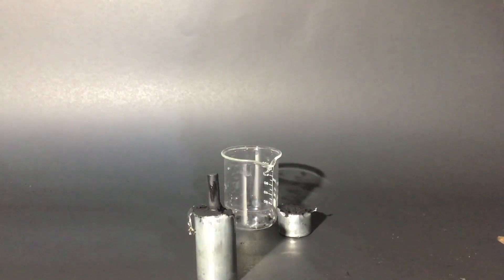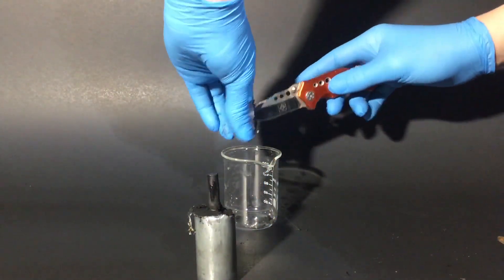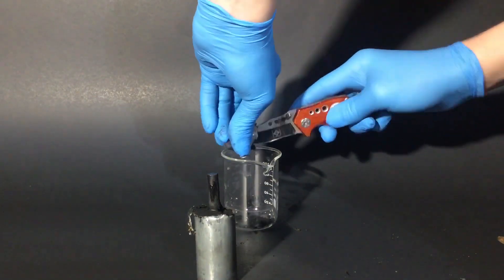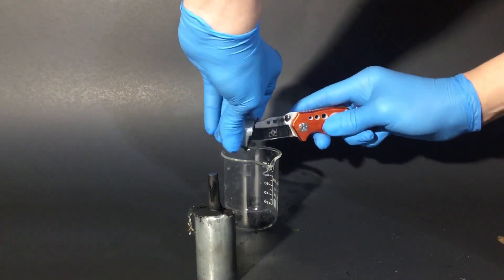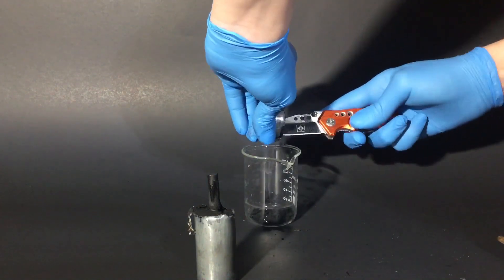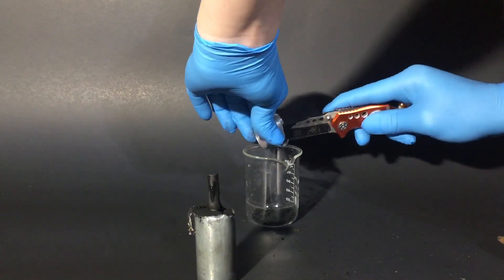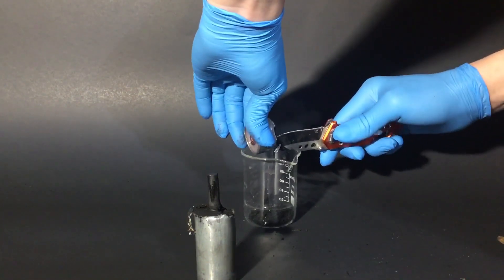Now for the fun part, which isn't actually really that fun. I need to take all the manganese dioxide out of the battery insides and put it all into a beaker. This is going to take a long time and it's honestly kind of inefficient because it makes a huge mess. But once this is done, I can actually get to cleaning it out with water.